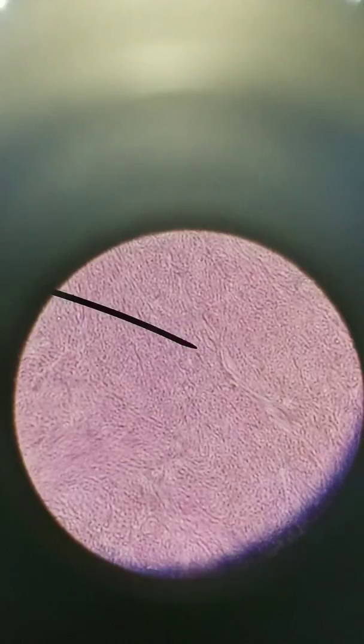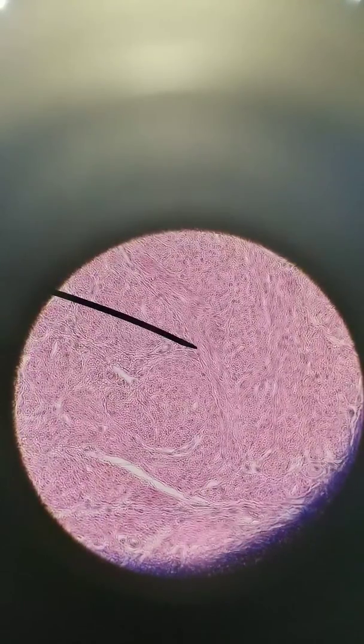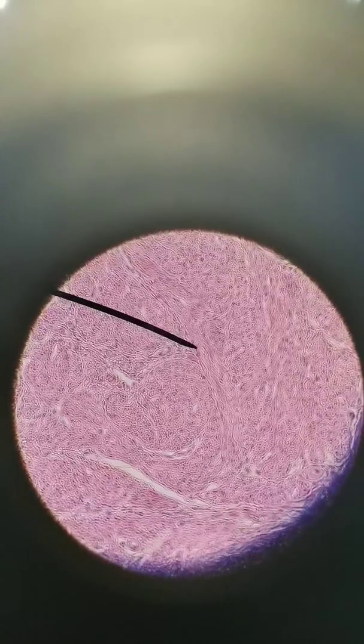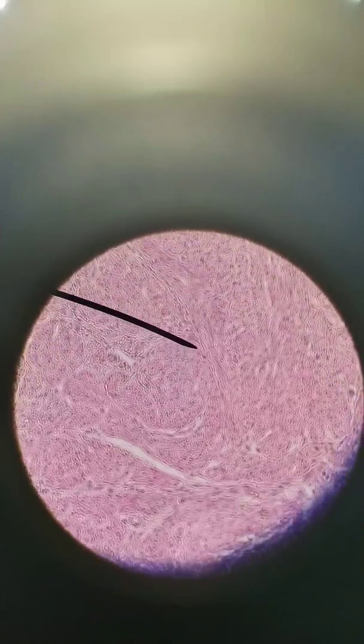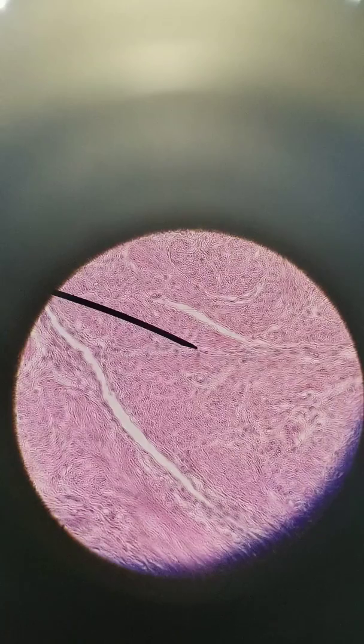I just want to show you real quick what smooth muscle looks like in a given tissue. So here is smooth muscle found in a uterine wall, so in the uterus. That's 100x. Here is 400x, and I'm just going to point at this region that's going kind of up and down. That would be a longitudinal cut of smooth muscle. You can see more down here. This is longitudinal. It looks very different when it's within tissue.